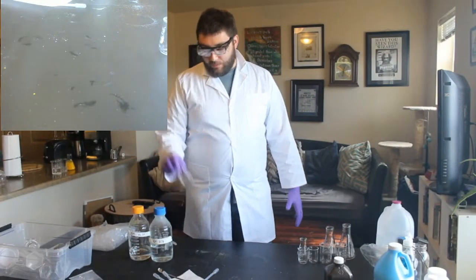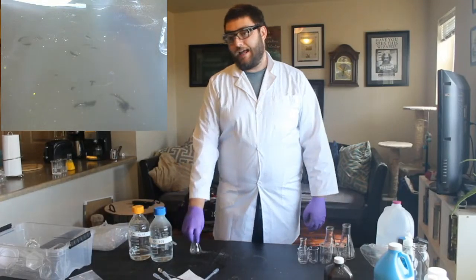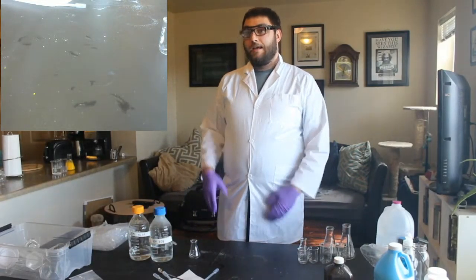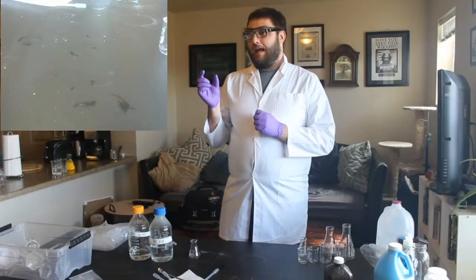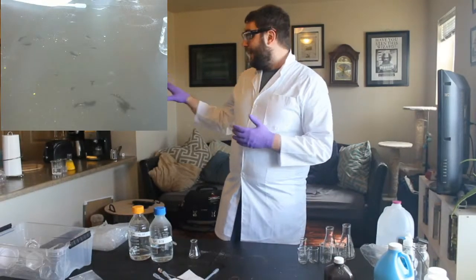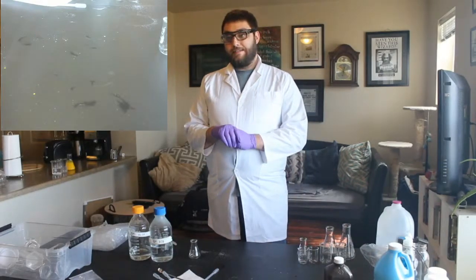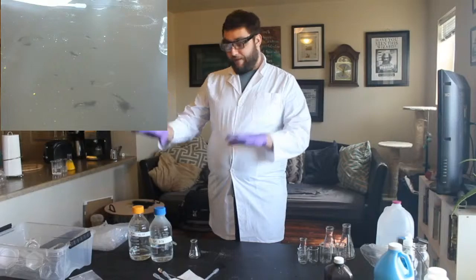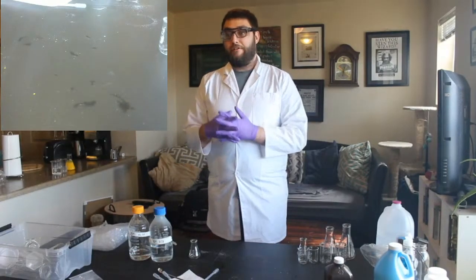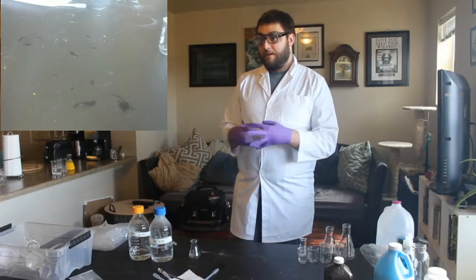And then this one, the potassium iodide and the lead nitrate, it made lead iodide. And that is what the lead iodide is, what is bright yellow. So we just made different things with different mixtures of starting stuff. That's a great question, though.